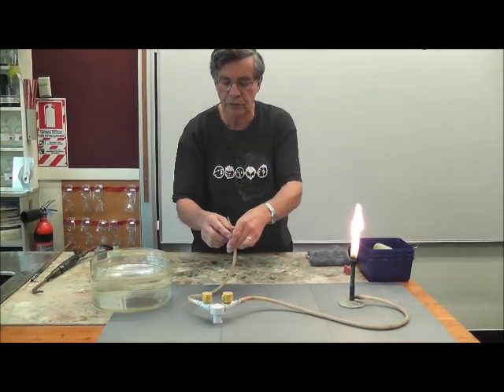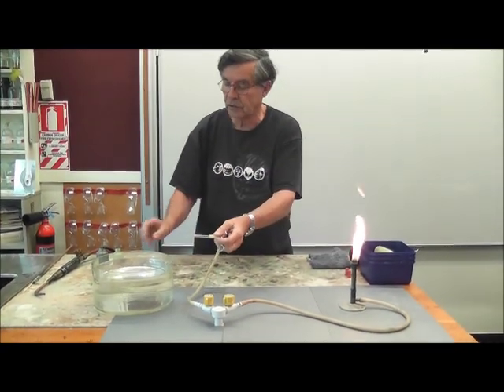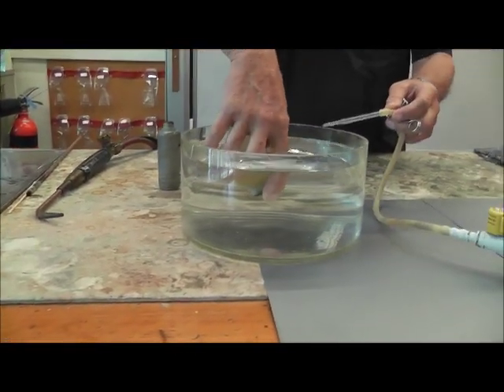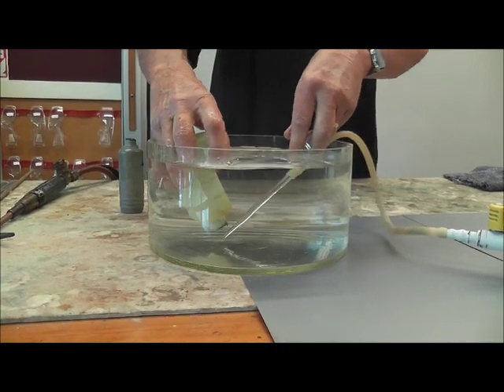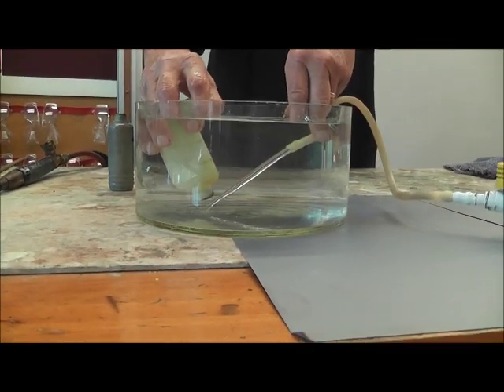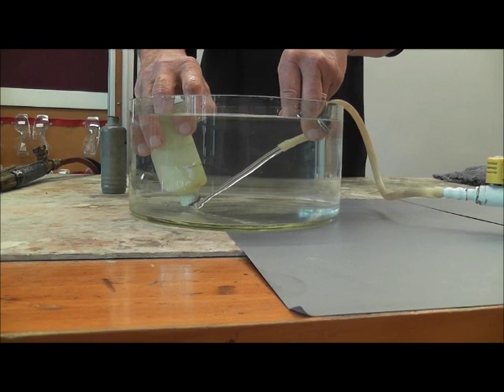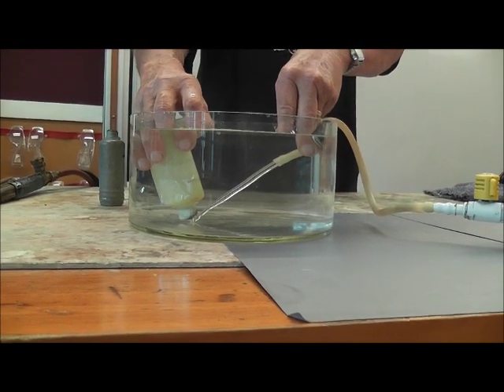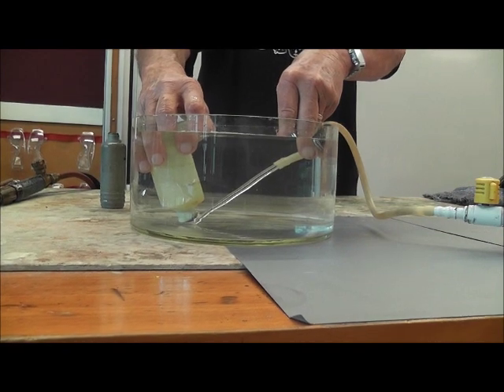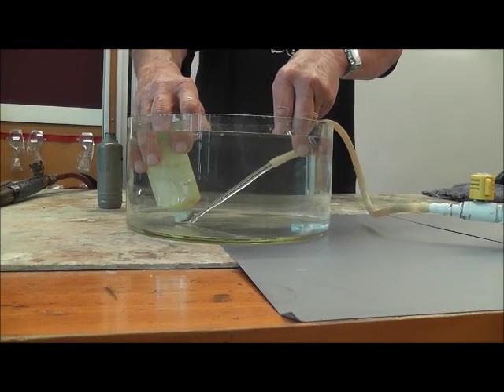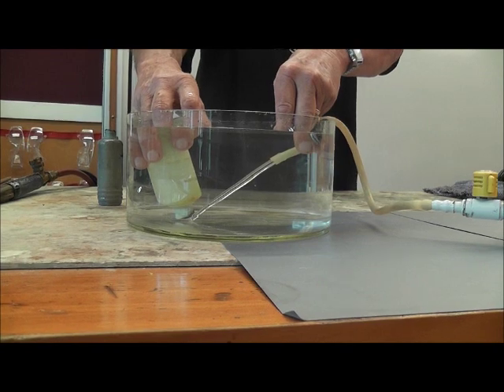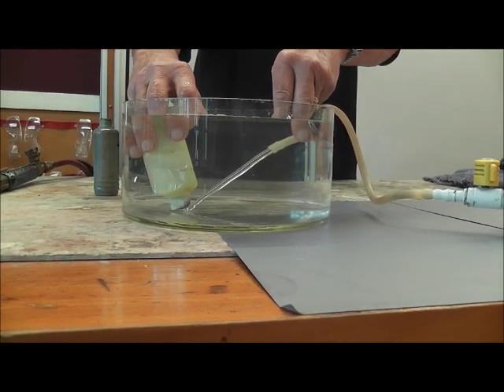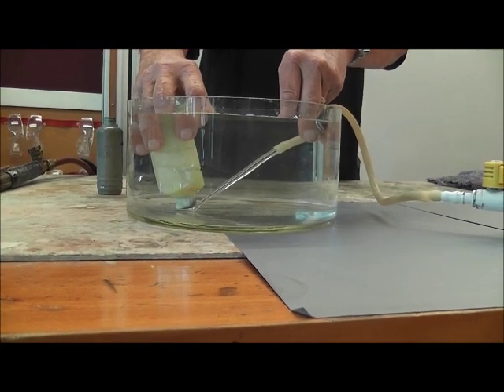That tells us the tube is full of gas. We're now going to take that gas and fill this plastic bottle with it. So I've filled it with water and we can proceed to bubble the gas under water. And as you can probably start to see, the gas runs into the container quickly displacing the water downwards, and we'll fill up a container full of propane in a minute or three.